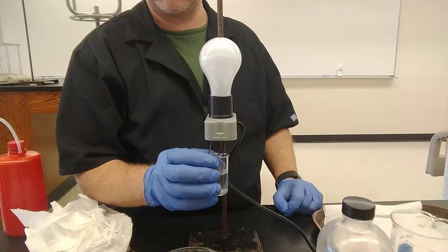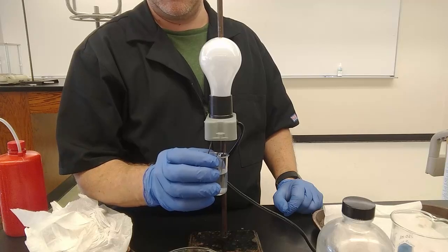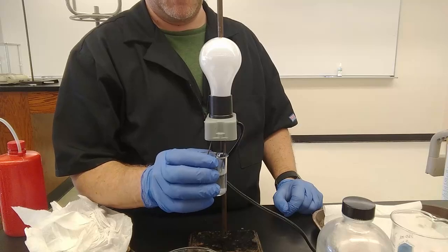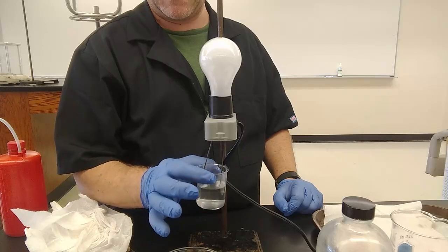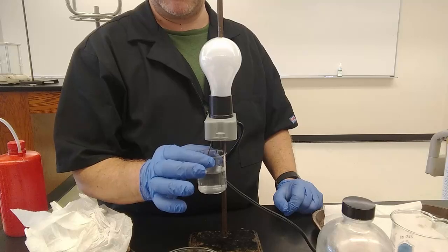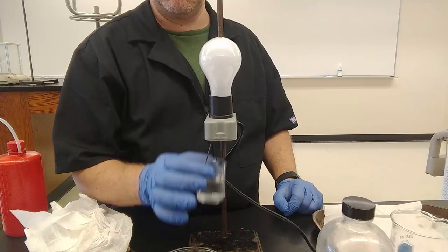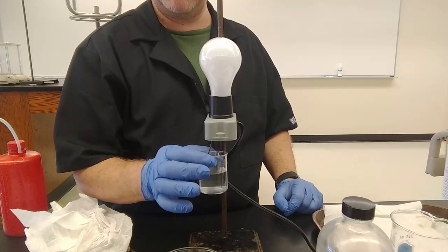And if it doesn't dissolve in water, just like those solids we tested at the beginning, you cannot determine whether it is an electrolyte or not by this method. You can take the solid and melt it and then test it with this. It just would be really, really, really hot. But you could melt sugar, test it, no light. Melt magnesium hydroxide, like 800 something degrees, the light would come on because the ions would be mobile.